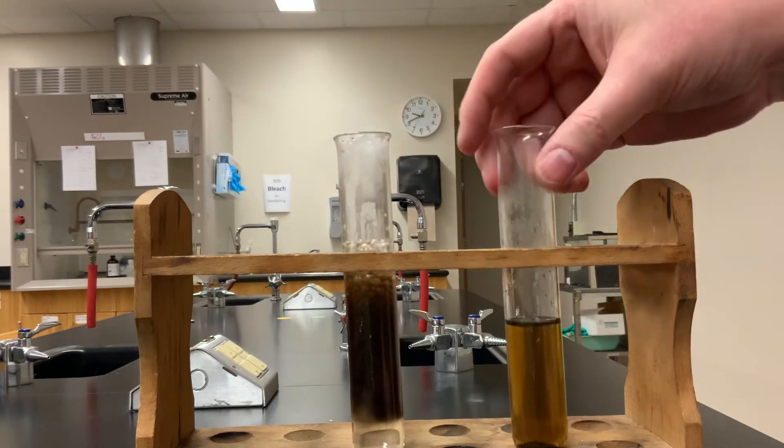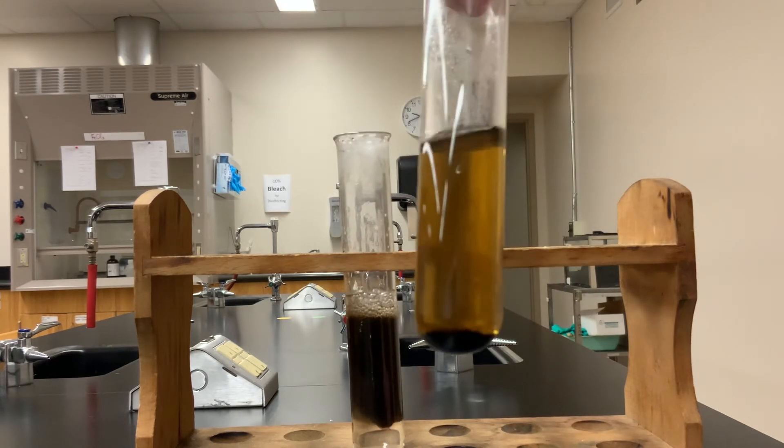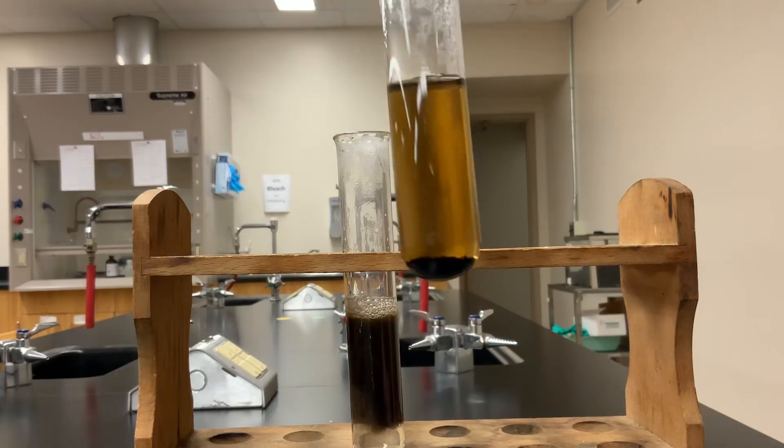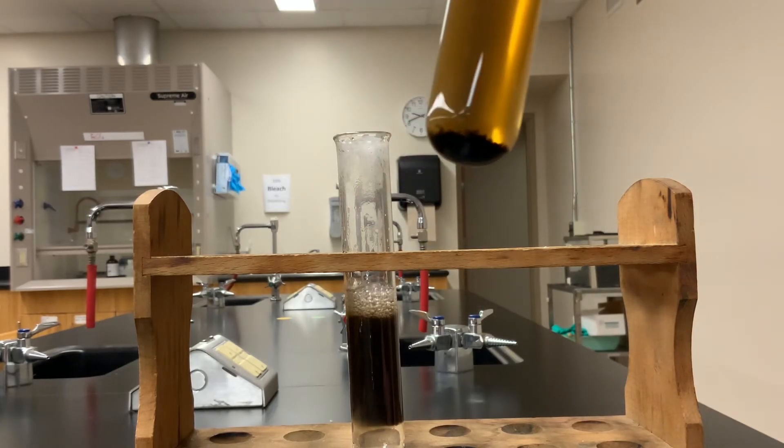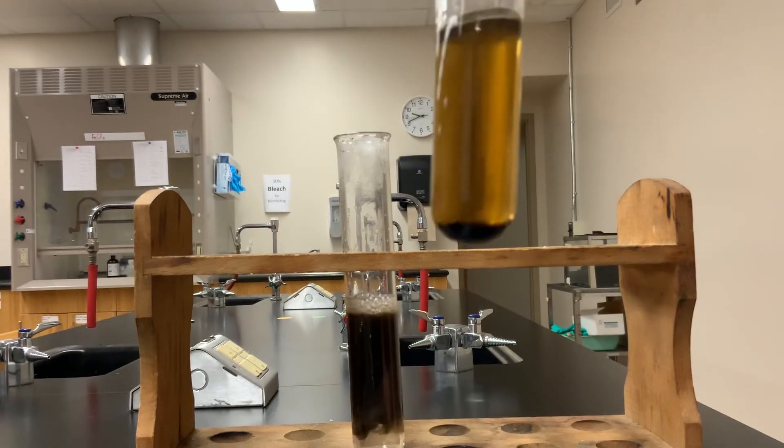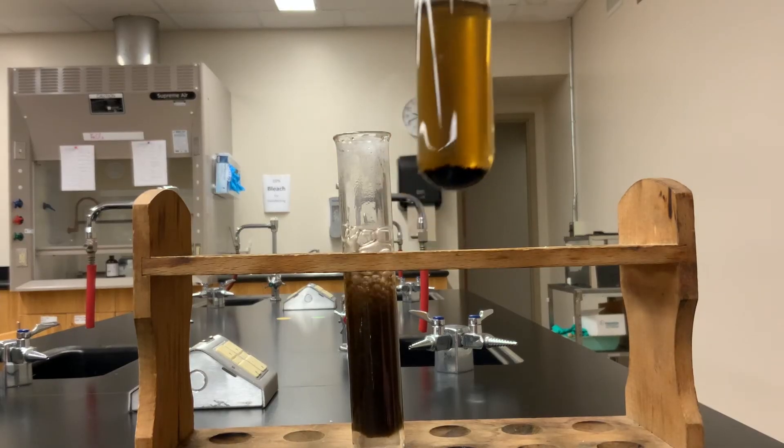Eventually, it completely reacts, and this is what you'll get at the end, looks to be a brownish, blackish precipitate which has sunk to the bottom.